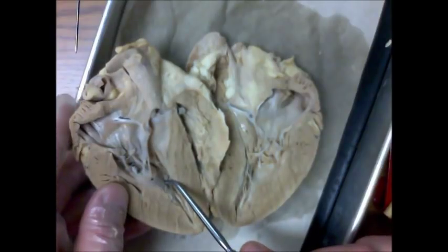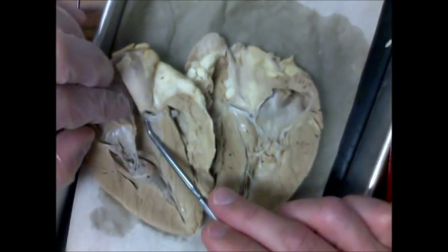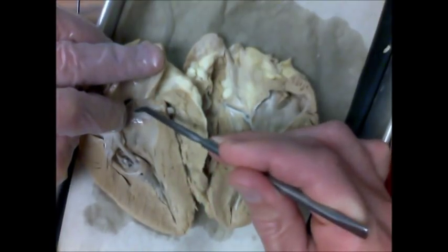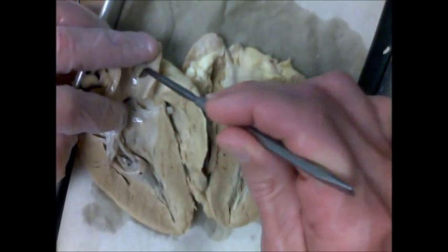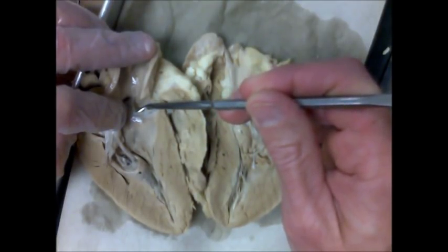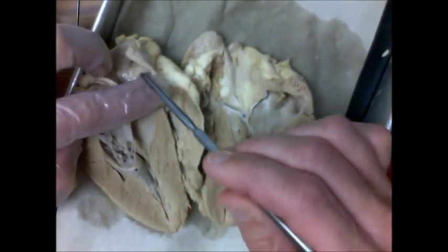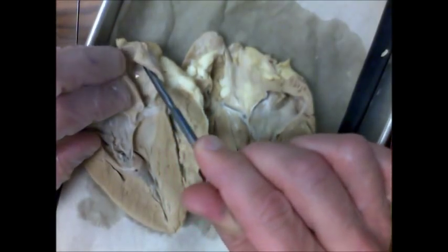Blood gets pumped out of the left ventricle, moving past the semilunar valves — the aortic semilunar valves. These are very thin, half-moon or cup-like valves that allow blood to move up and out. But if blood moves back towards the ventricle, it fills those semilunars, closing them shut. Here we can see the aorta that has been cut open. Branching off the aorta is the brachiocephalic artery, which carries blood to the head and to the arms.